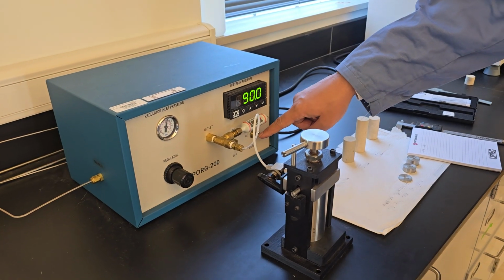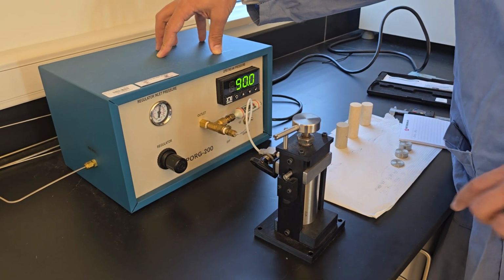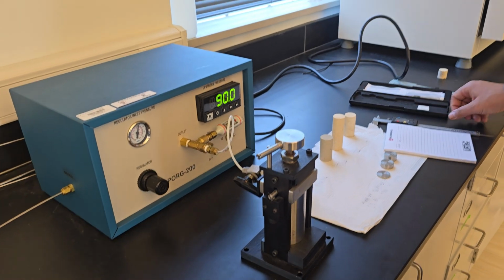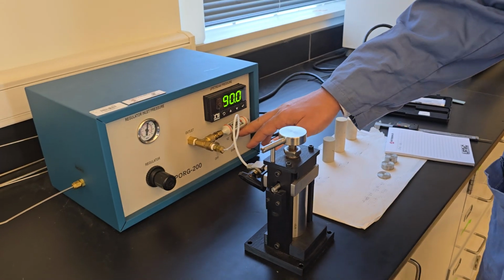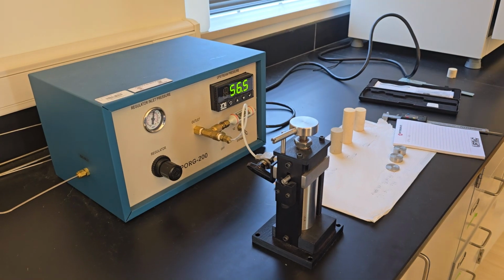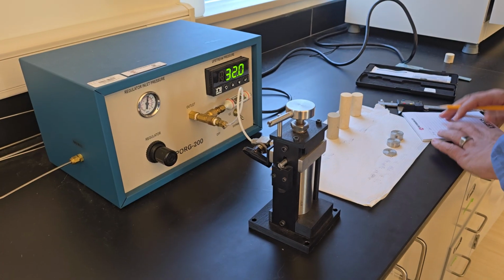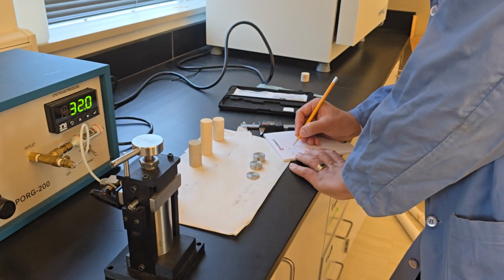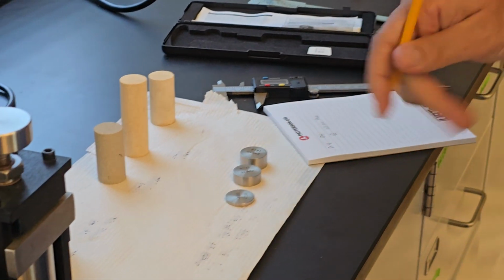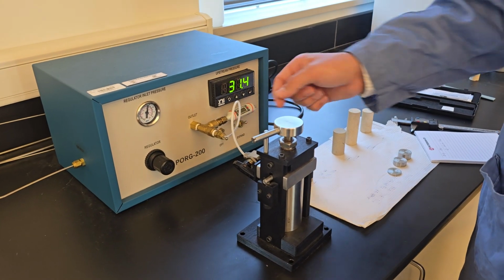Now once I open the vent, the valve will open and connect the reference chamber in there and the outer chamber here, which has my sample. So I write that the initial pressure is 90. I record it on my system and my data sheet, and then I put this from vent to expand. Once I put it in the expand, I wait until it stabilizes. The pressure stabilizes around 32, so I'm going to type down the pressure as 32 PSI.